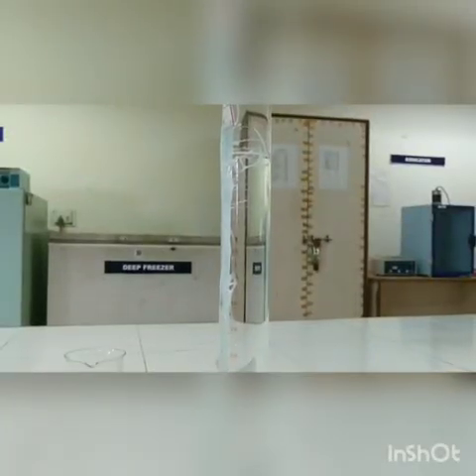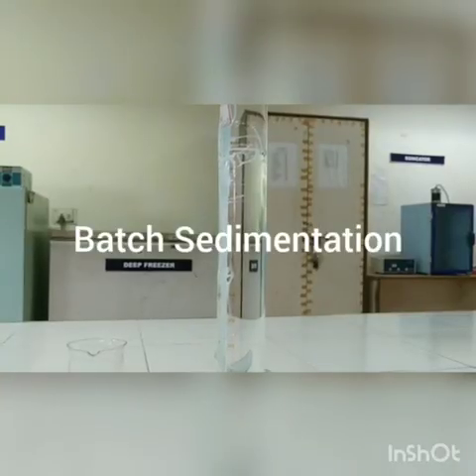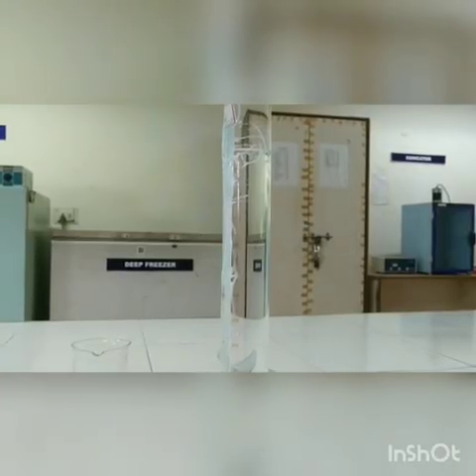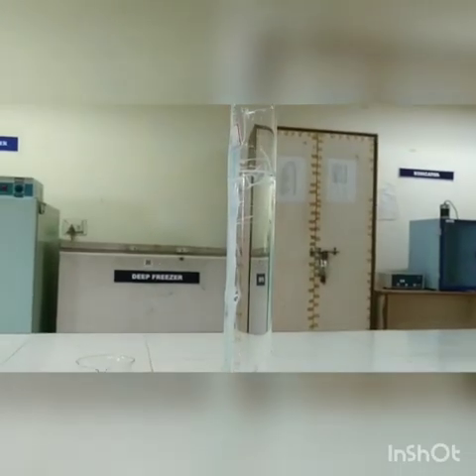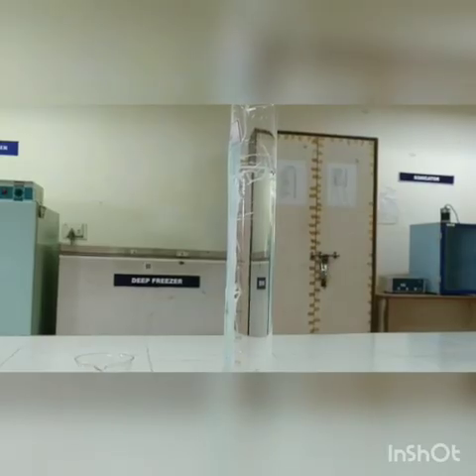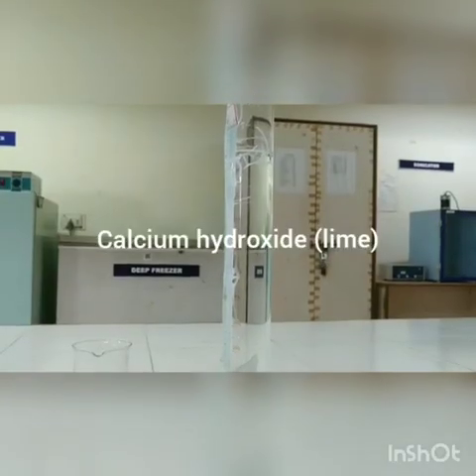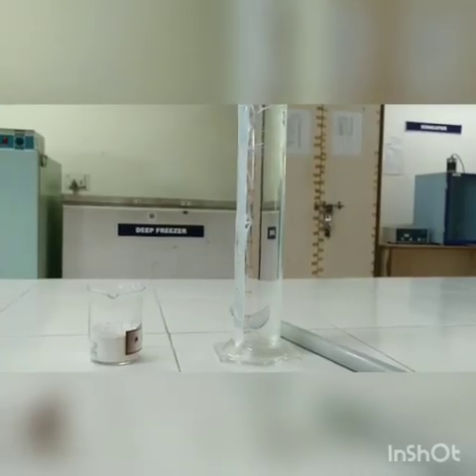Students, today we are going to see about batch sedimentation procedure. For this, we need a 1 liter transparent measuring cylinder in which the water has been filled. And to mimic a slurry system, we are going to use the calcium carbonate lime. So the lime is going to act as a slurry.